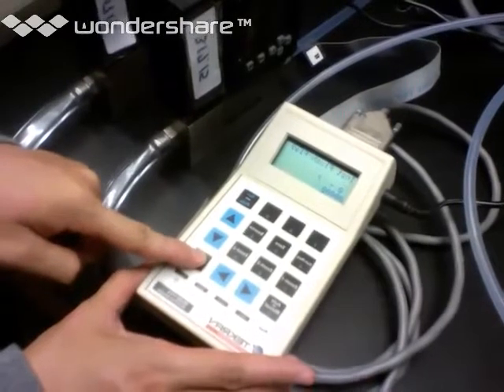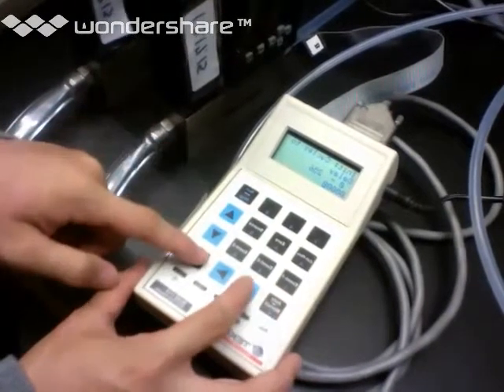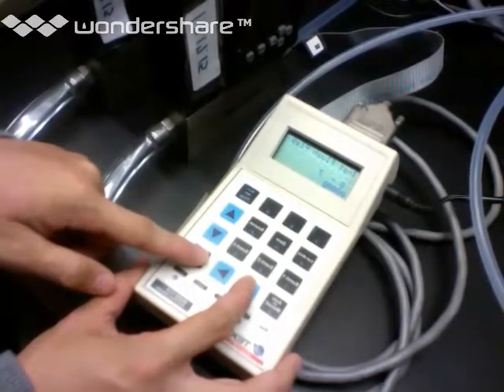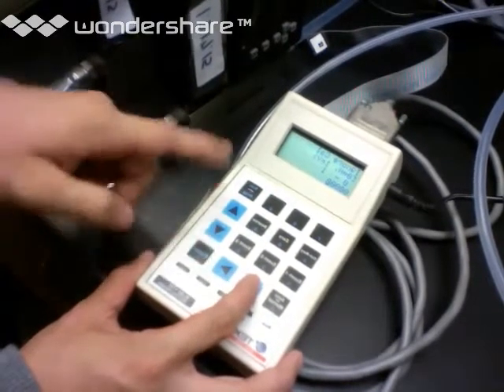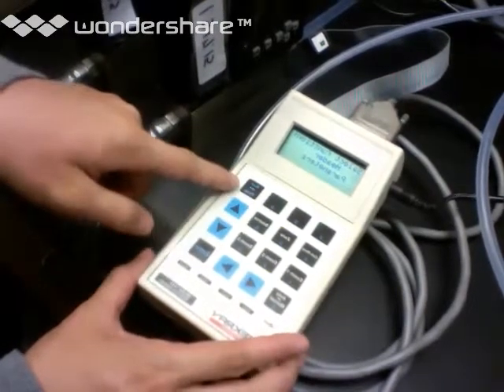These are flush things, some flush flag. Okay, so we're done with this. Essentially, make sure that you don't ignore the calibration, and we don't have any instant flush. There's not too much to do in this particular section. To go back, you just press Run Program again.